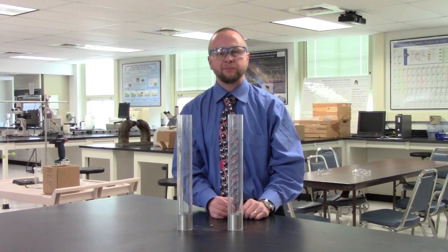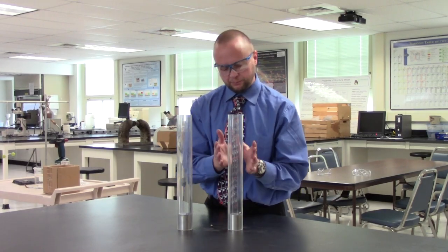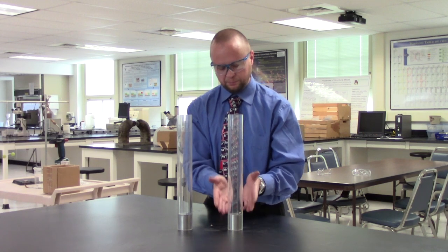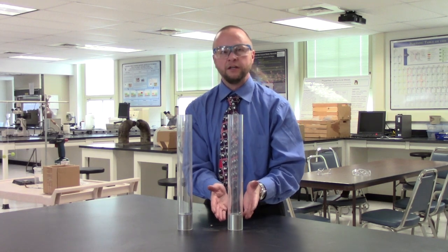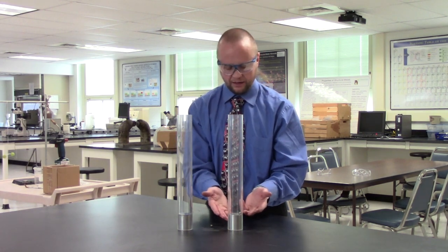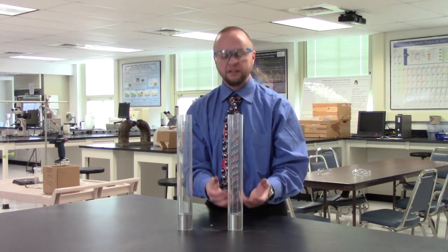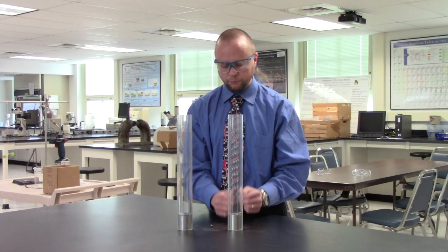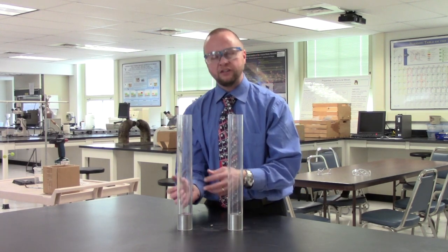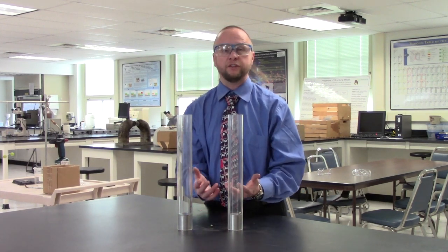Pretty boring. So now what I'm going to do is take this piece of metal, which we've previously described as being crystalline, and I'm going to change that crystalline nature to amorphous.